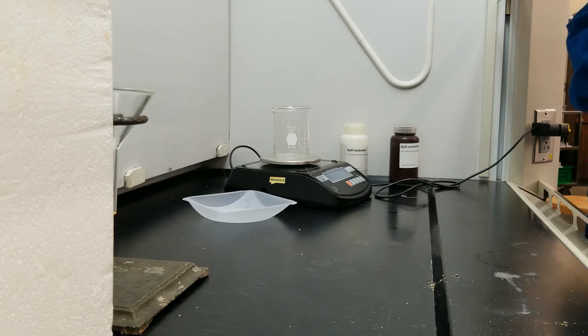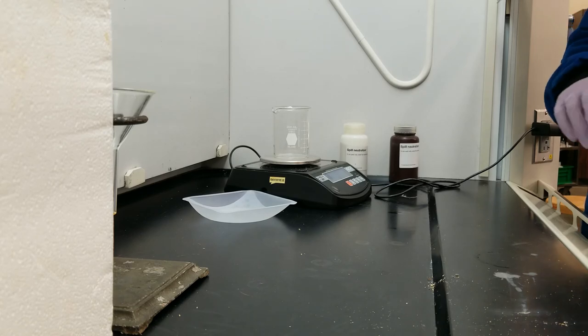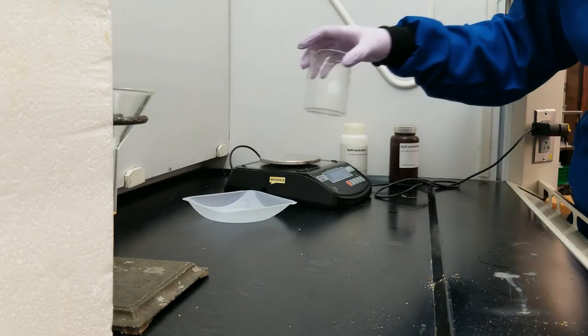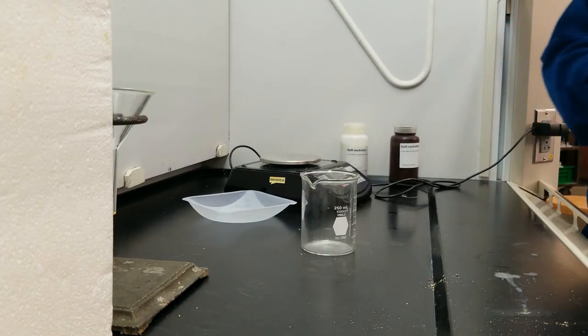My beaker without fat is 113 grams, 113.35 grams. So I can go and fill in that data on my data table, and then I can start my calculations.